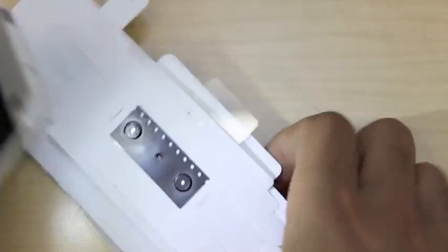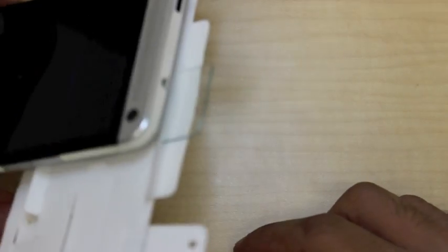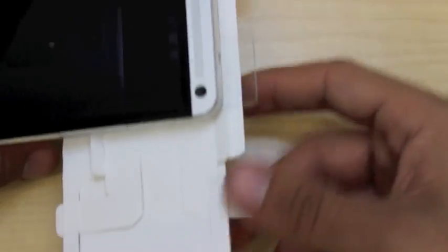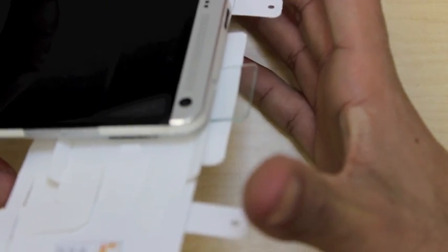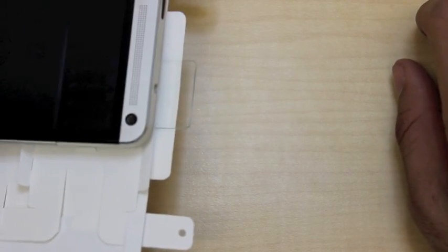There are apps you can download on your phone which allow you to turn your flashlight on and off. When we attach the foldscope and turn it on, the flash will now be shining through our sample. There's a lot of lighting here so it's difficult to see, but there is an image being projected onto the table. It may work with some phones and may not work with others, but you should definitely give it a try just to see if you can show your friends the same sample that you can see.